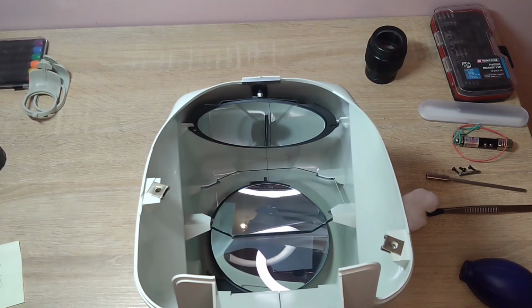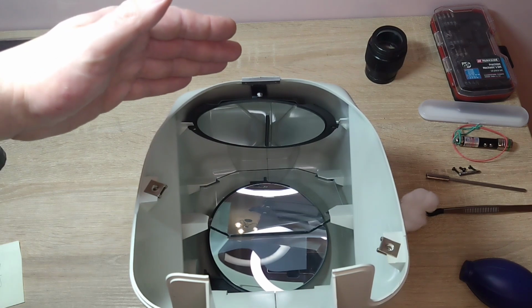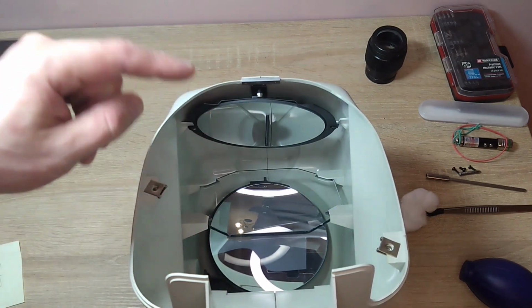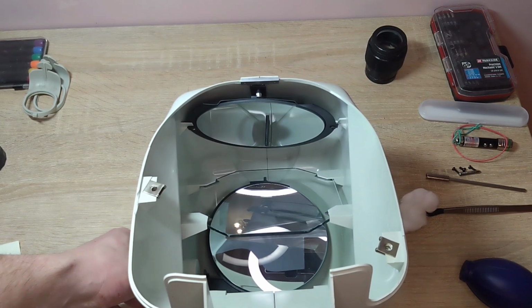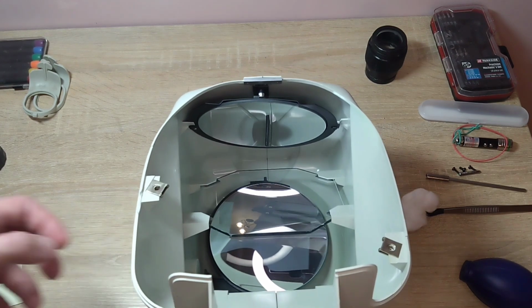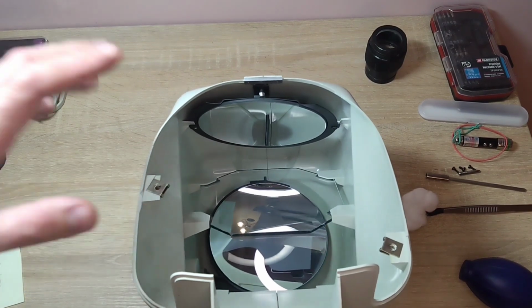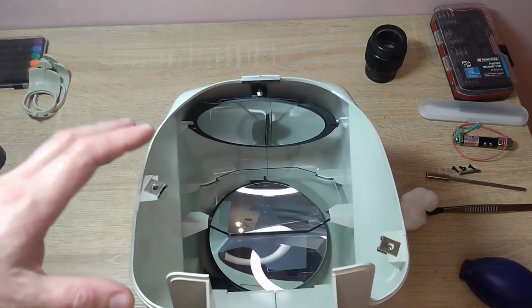When we look with our eyes at these two images, our brain combines these two images into one. And it seems to us that we see some kind of three-dimensional picture that is stereo vision. This mirror is positioned at a slight angle to provide an image for one eye, while the lower mirror creates an image for the other eye. It can also be adjusted to change the interpupillary distance. The owner of this microscope says that sometimes it seems to him that the image doubles. I also seem to have noticed something.